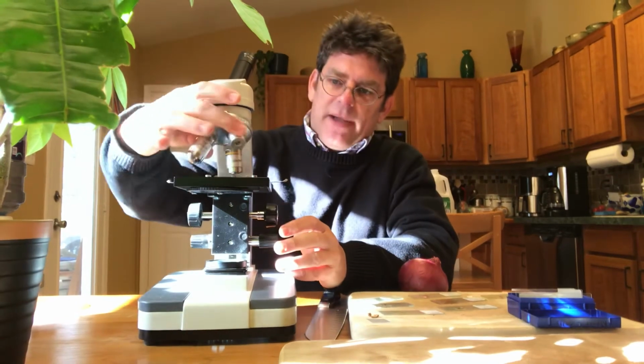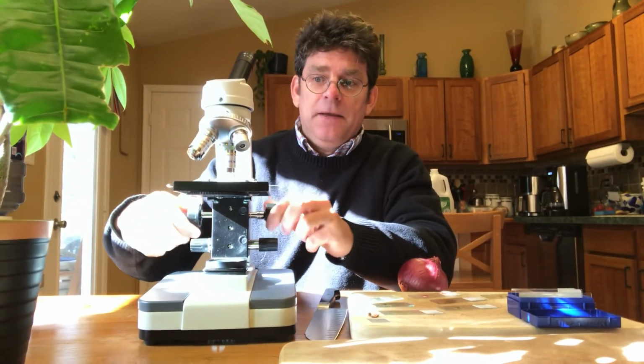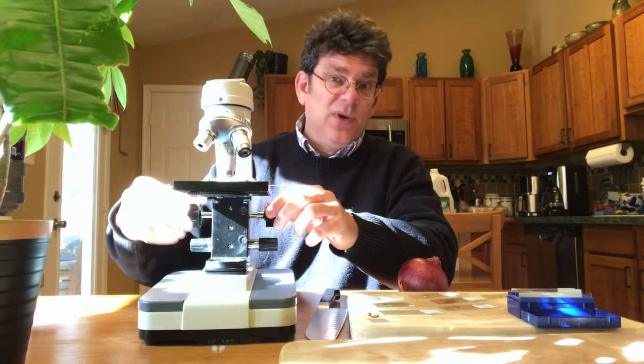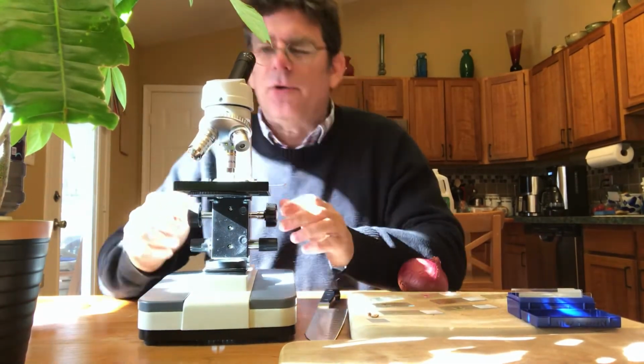Right? Again, if I go back to medium, this coarse adjustment knob moves the stage very quickly. So imagine on high power, students do this. This is how slides get cracked. They crank that up into it. And you really won't see it that way anyway. Always better to find it on medium, then go to high power and you'll be able to see it.